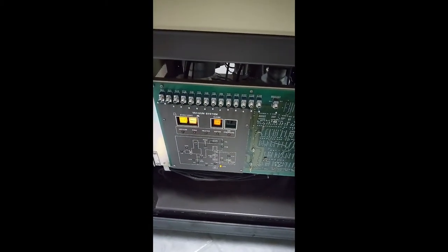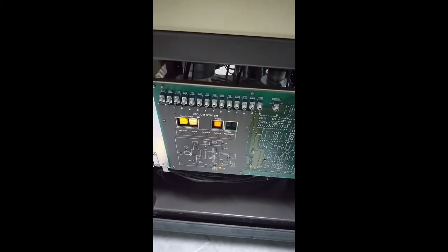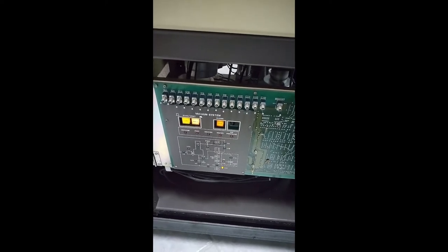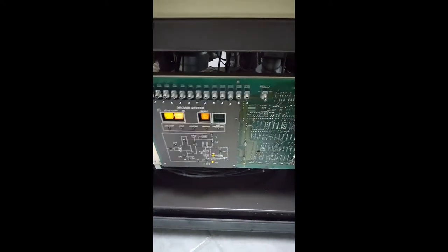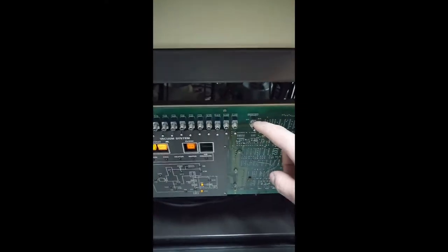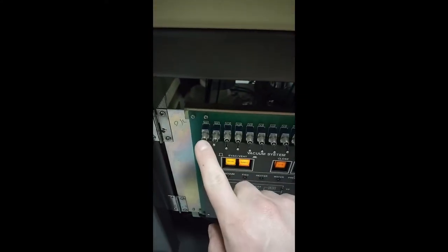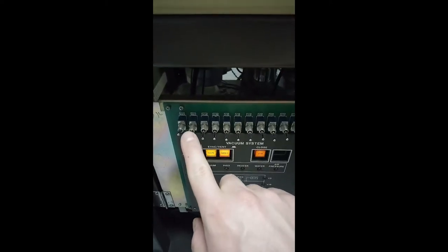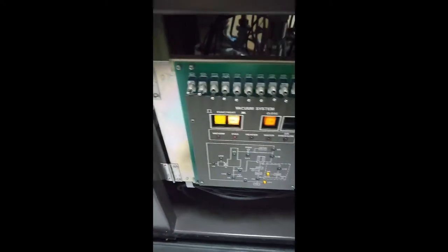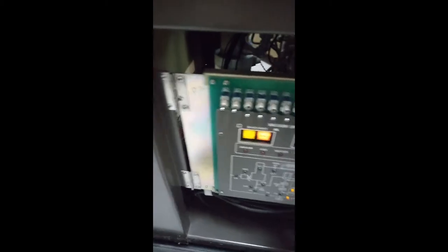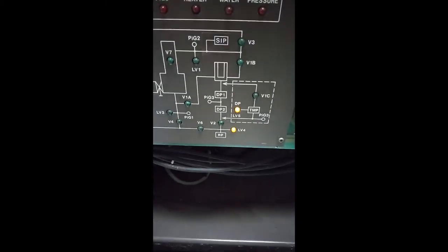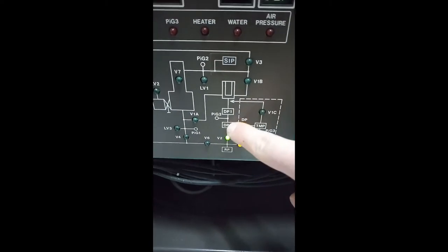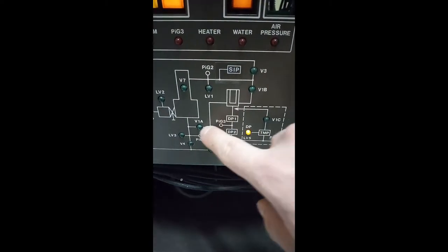The vacuum board functions, but it takes quite a while to get to its next stage. So usually I will just run the system in manual mode. That's the switch right here. So we have the rotary pump on and the diffusion pump heaters turning on. And the very first switch to engage is V2. This is from the rotary pump, and this is going to begin pumping down the diffusion pumps.